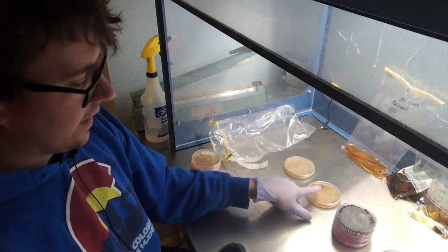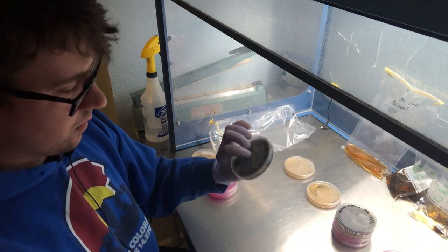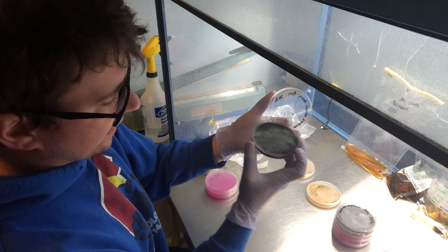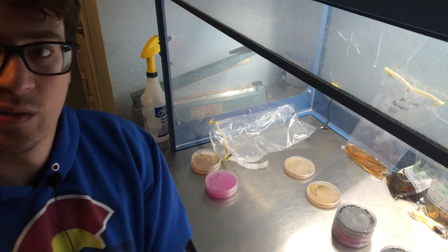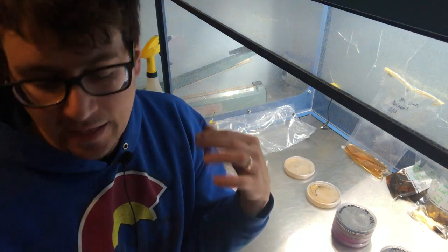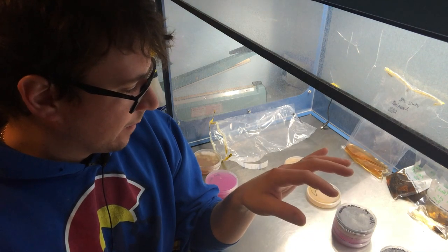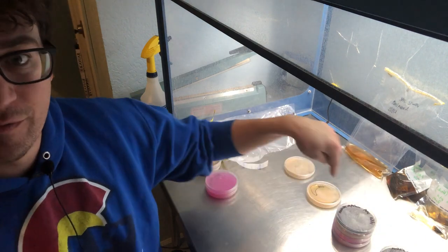This is an early burn morel so it had a little bit less contaminants - let's check this one on the black charcoal. It is completely overrun by mycelium, and it looks a little bit healthier than the MEA plate so I'm going to try to segment from that just to see what happens. You can see the difference between the MEA and the black charcoal growth is so much faster - I probably could have looked at these 10 hours ago. I'm going to inoculate a couple plates with the mixed spores and then segment off some of these sectors.